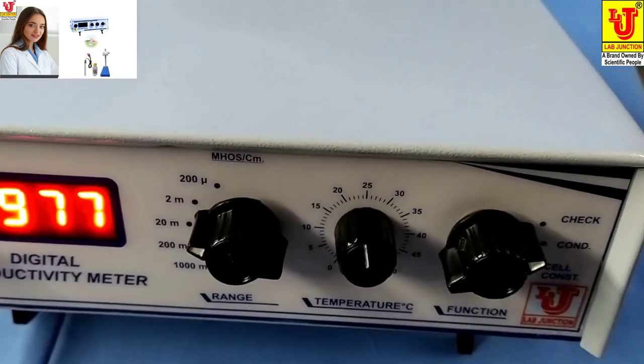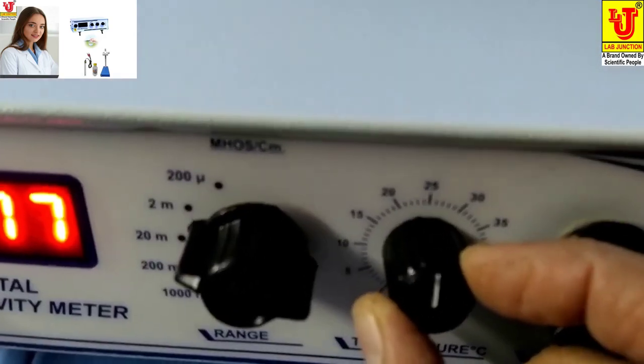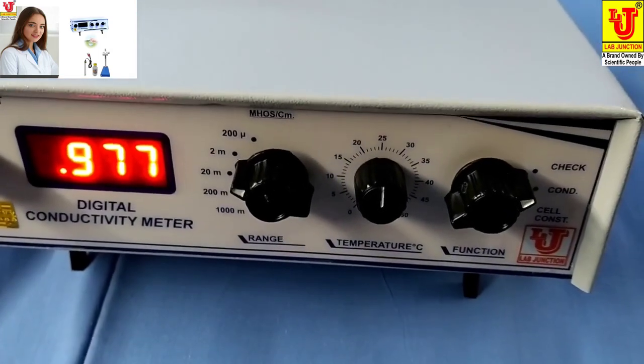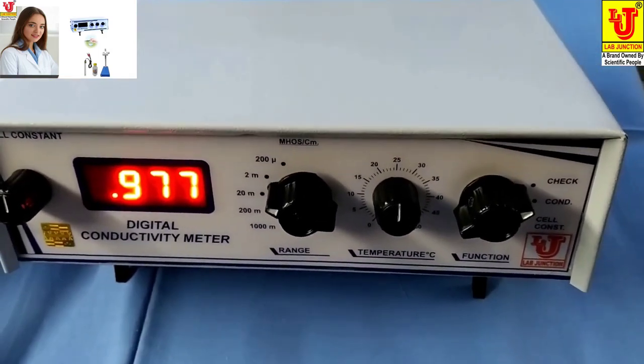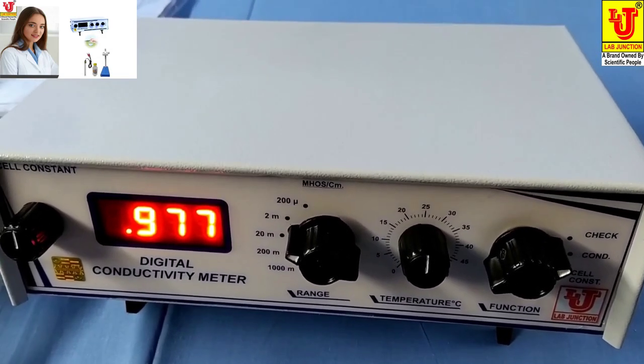First of all, you have to set Temperature 25 degrees. If you have another temperature, then you can set to your own temperature as you have desired your conductivity on that temperature.